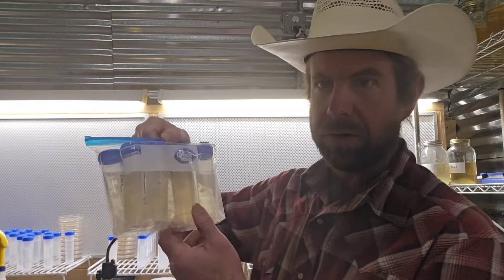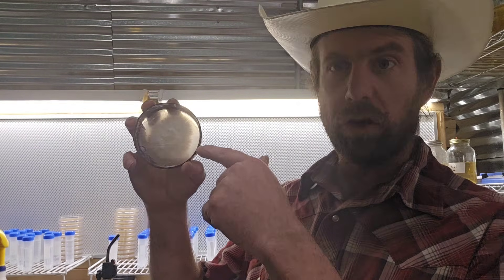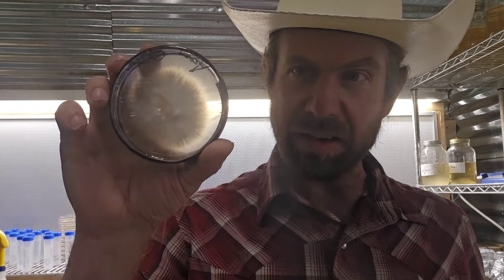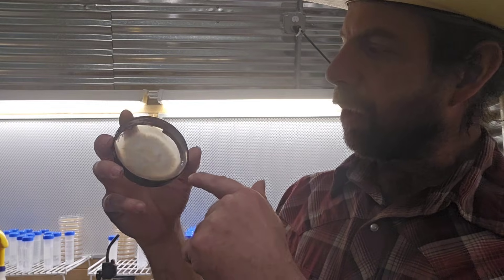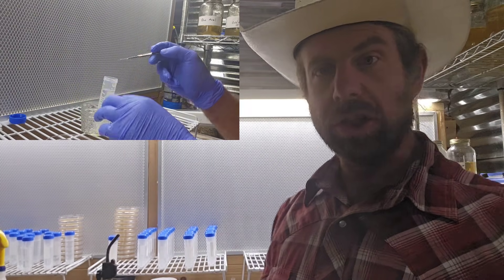Let's talk about keeping your mushroom cultures around for long-term storage. I've got a whole bunch of centrifuge tubes prepared here. I like to make basically an agar slurry master culture. I have a few of these created right here — extremely simple process. You actually have to grow out your culture on agar first. I'm going to preserve this culture I have right here. How long can these cultures last in these tubes? Several years — they can actually keep for several years in a tube like this under refrigeration.